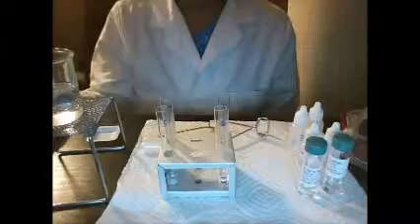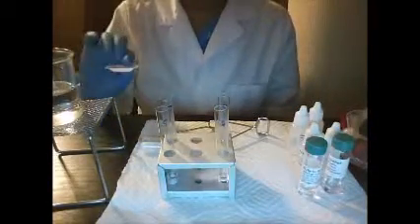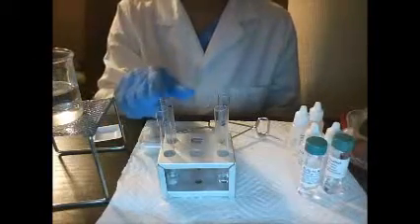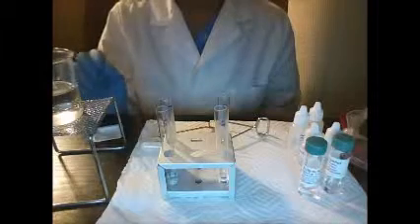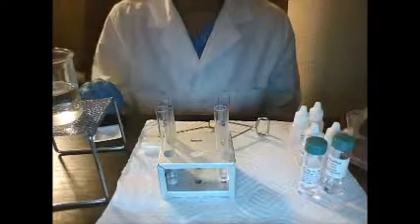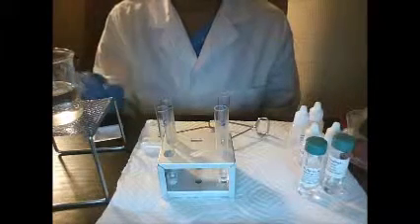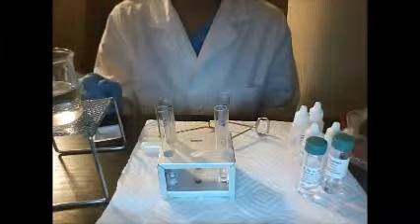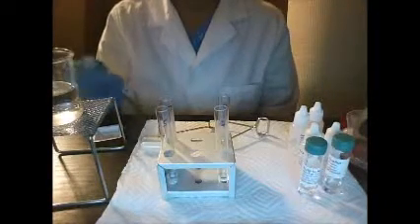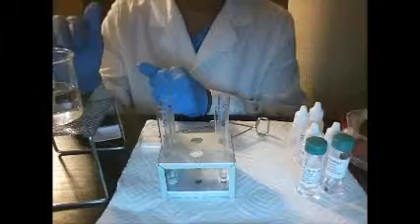I placed 0.2 grams of salicylic acid and transferred it from this little cup here into test tube number 7. And then I added 6 drops of the methanol into test tube 7. And I agitated it a little bit and shook it up and mixed it. And then I added 2 drops of concentrated sulfuric acid into test tube 7. And then I shook the test tube as well. And I boiled the water. And I set the tubes in there for 5 minutes.